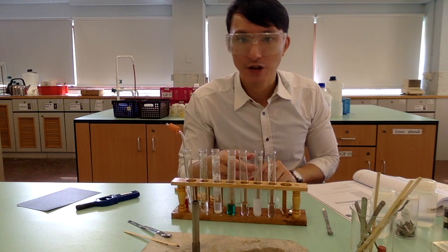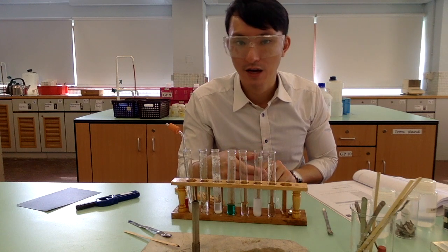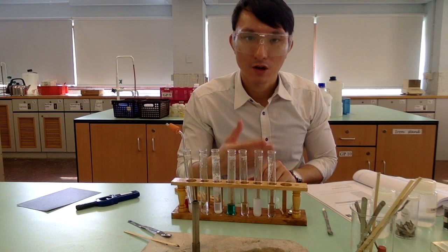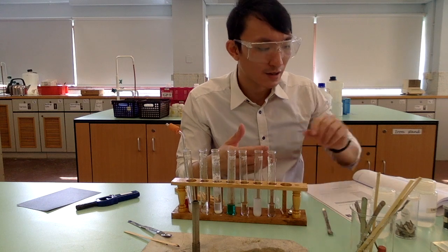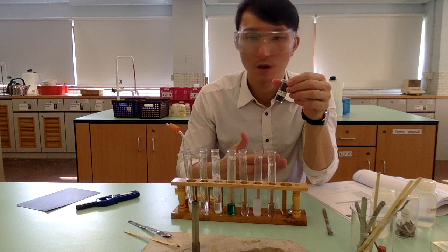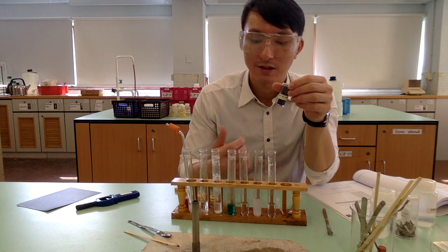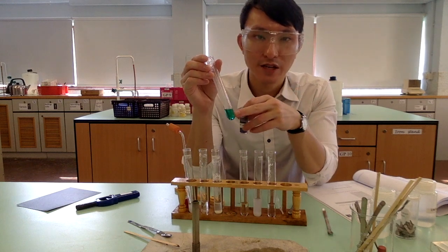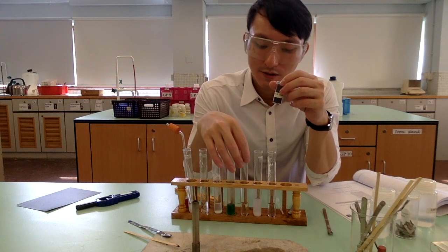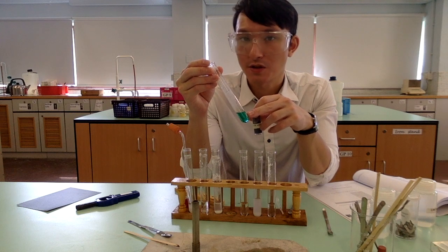Now, in the third reaction, we are exploring the reaction between metal oxide and metal hydroxide with acid. We demonstrated using copper 2 oxide, which is a black solid, and when we add it into the hydrochloric acid, there is no observable change. And when we heat it with the Bunsen burner, we see that the solution has turned green and the black solid has dissolved. Obviously, the green color is due to the copper 2 ions.